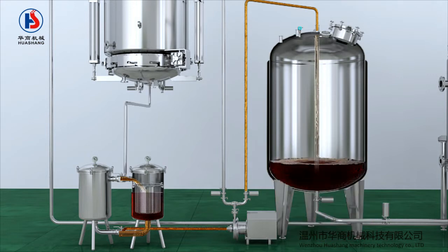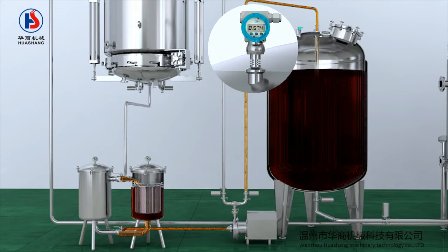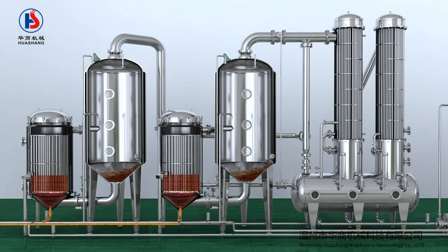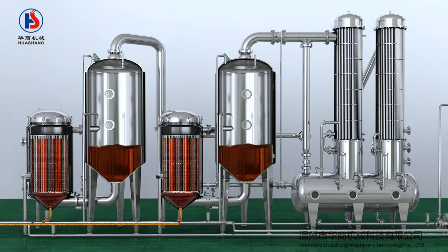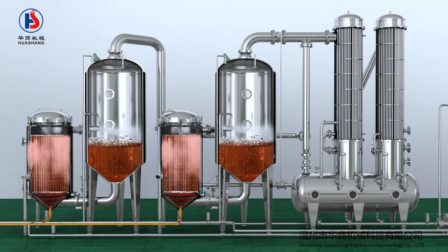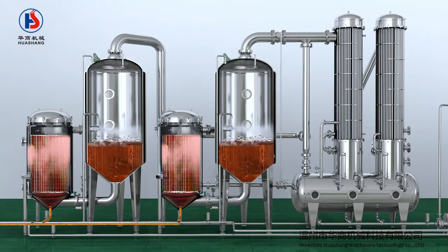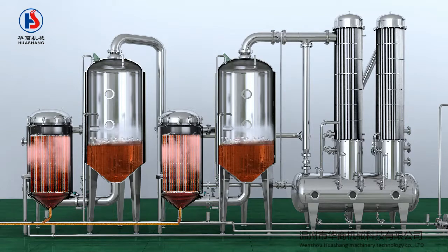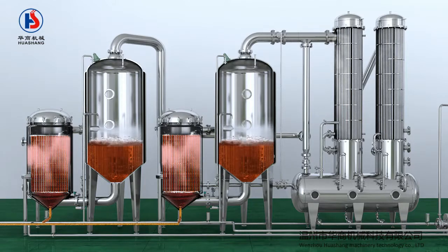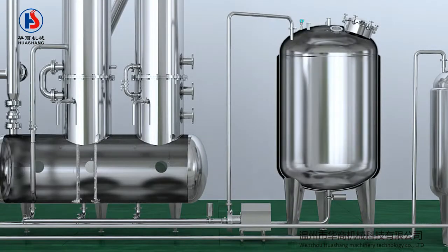Then vacuum pump the liquid to the concentrator, and the liquid inside will slowly increase. When the liquid level reaches the preset level, open the heater steam valve and evaporation chamber. The liquid will gradually heat until boiling. The produced steam is ejected by a curved guide slot and can be used as a heat source for a second heater. Slowly heat the double-effect evaporator, and the produced steam is ejected by a curved guide slot as well. The steam condenses through the condenser, and condensed water returns to the liquid storage tank.